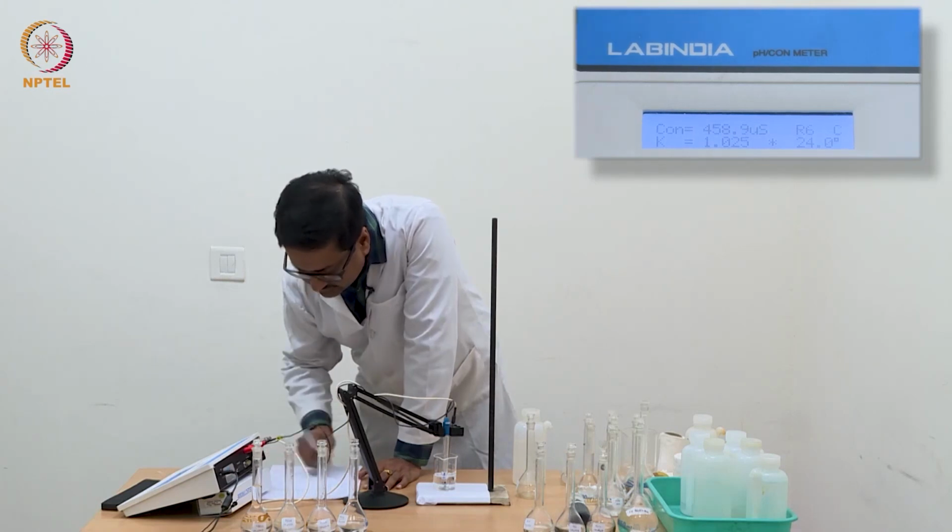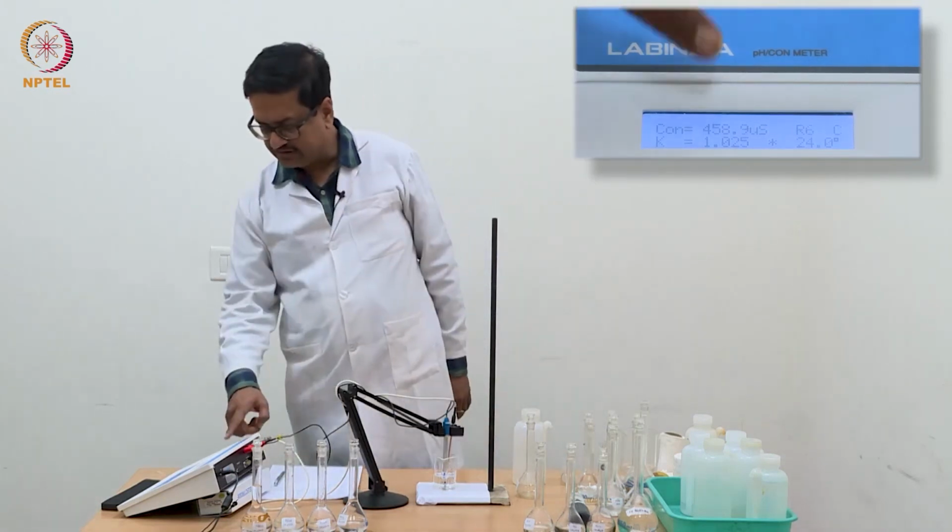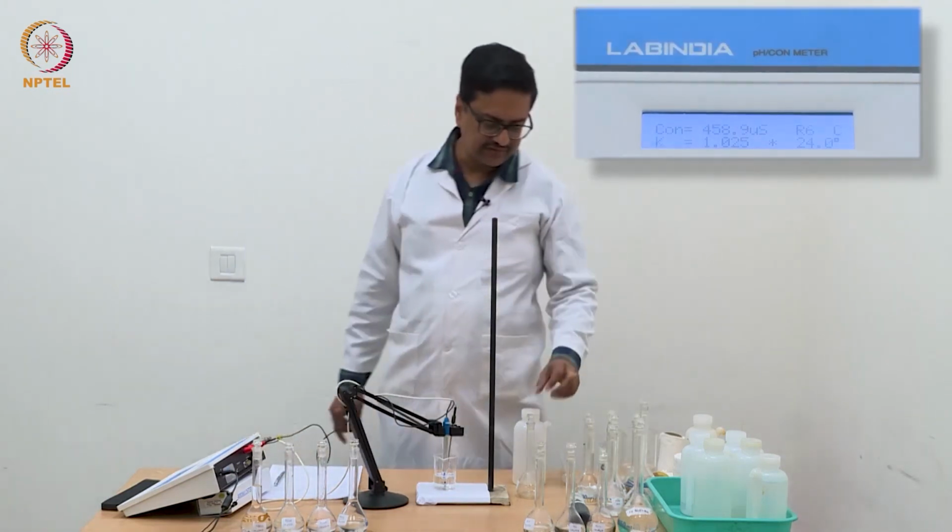Remember that we are still in the microsiemens range, which you can see from this reading.